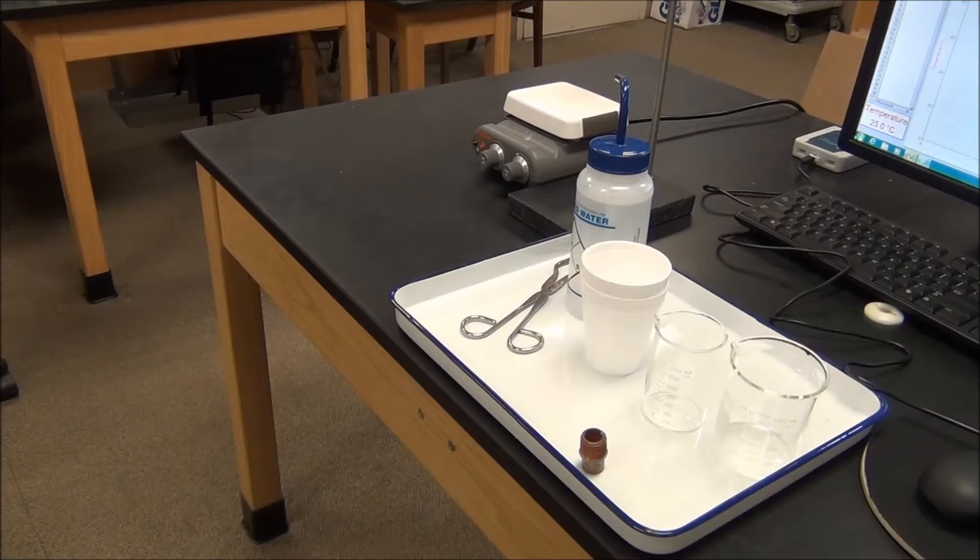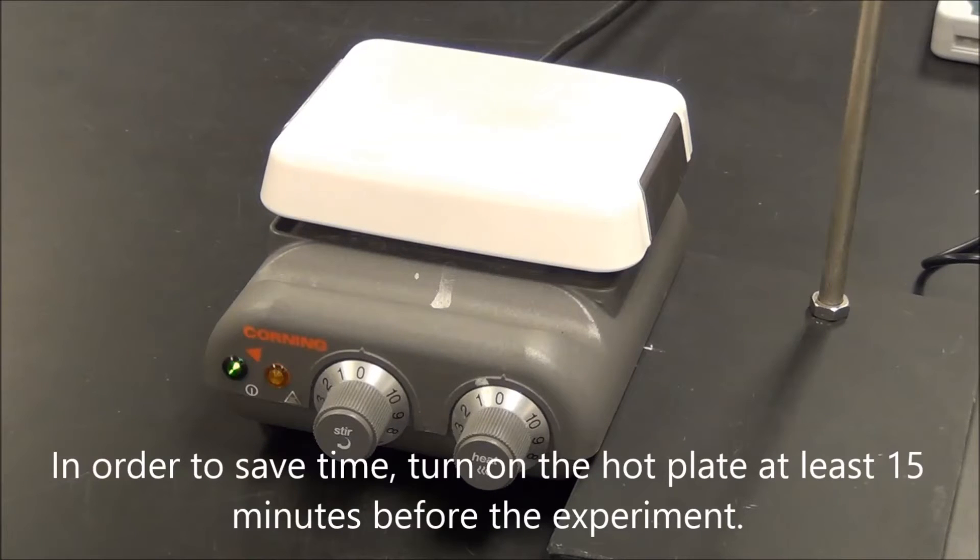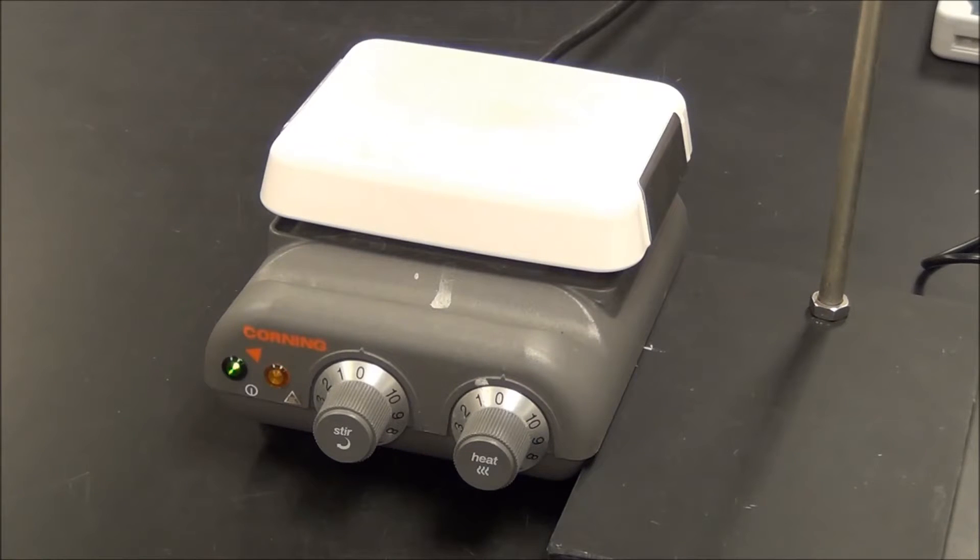This is what we have for the first part of Minilab 2. In order to save time, we have to turn on the hot plate at least 15 minutes before the experiment.